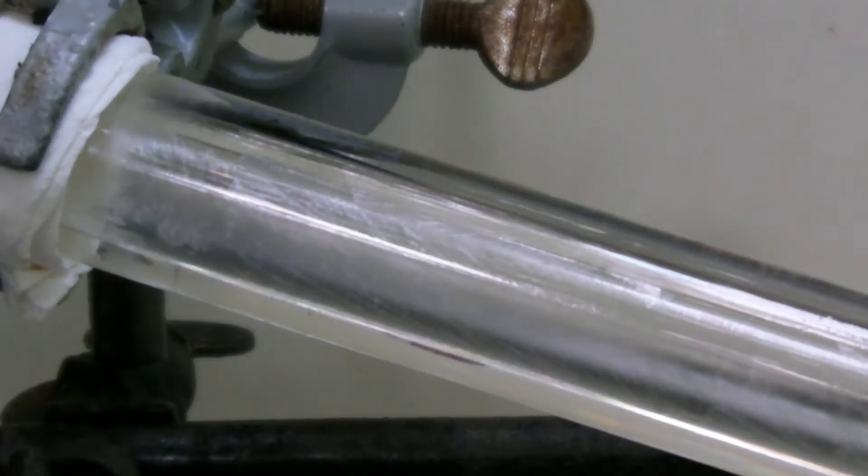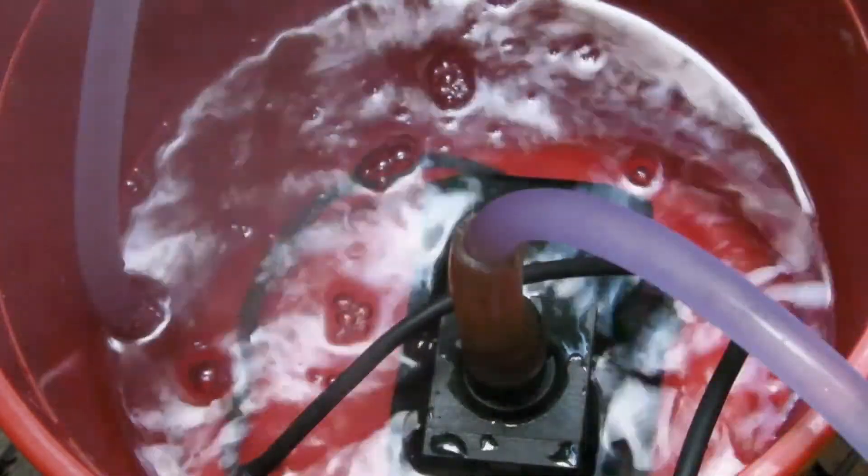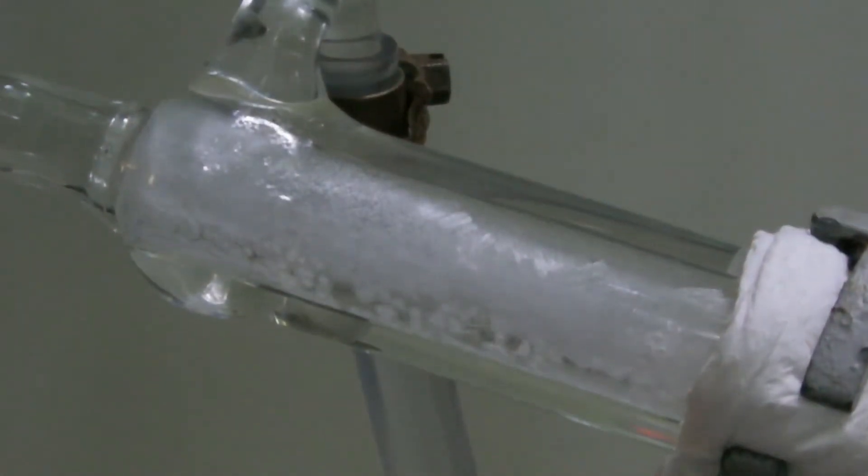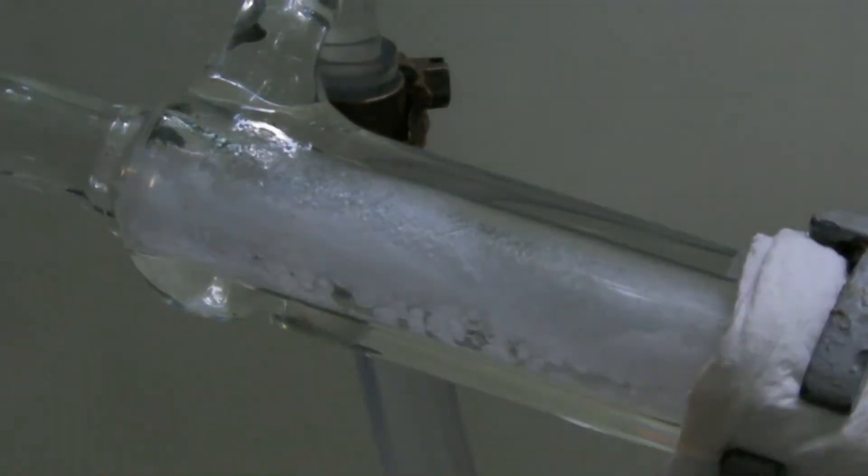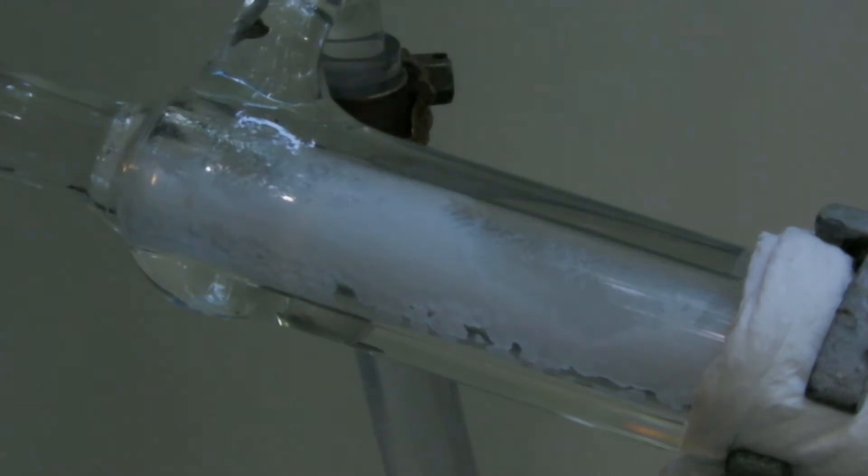That's why boiling water was held close by to increase the temperature in such a case. But still more of the sulfur trioxide was crystallizing than melting. So all in all while the reaction was taking place several liters of boiling water were added to the cooling water.